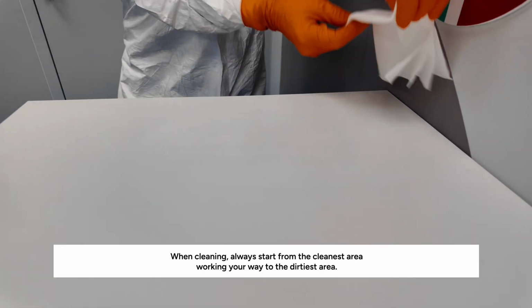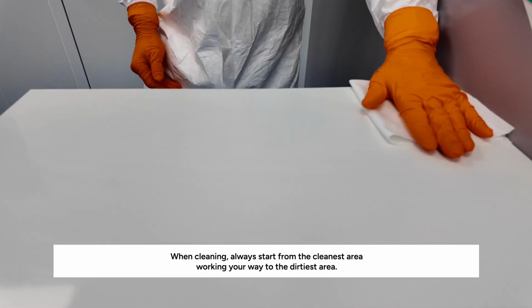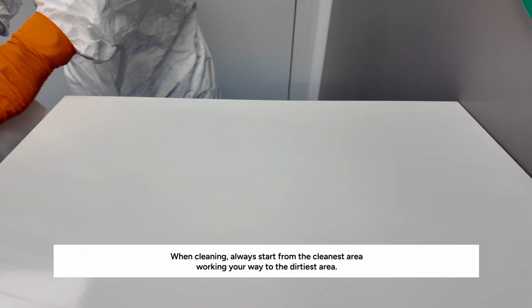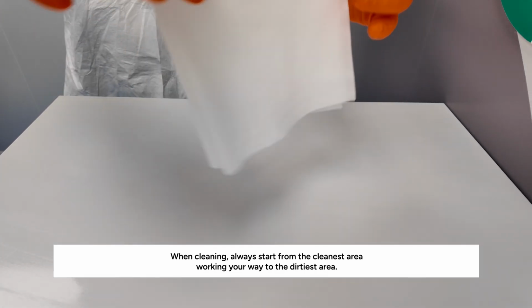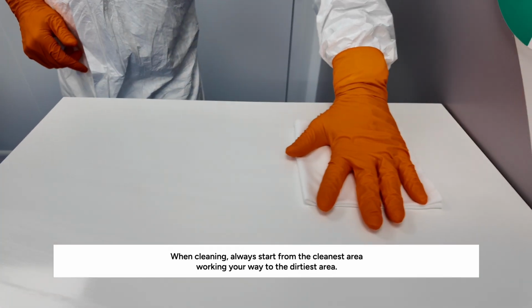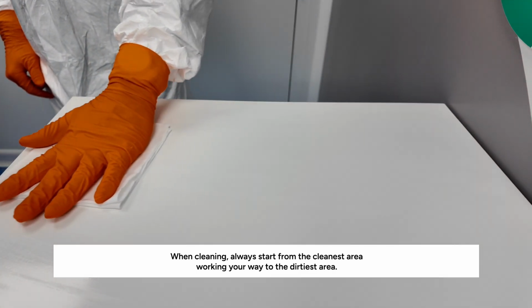Always starting from the back of your surface, press the wipe down with a good amount of pressure, using more of your palm than your fingers. This ensures the best level of contact between the wipe, chemical, and surface. Then, wipe the surface in one unidirectional stroke. After the first wipe, flip the wipe over to use the clean side.